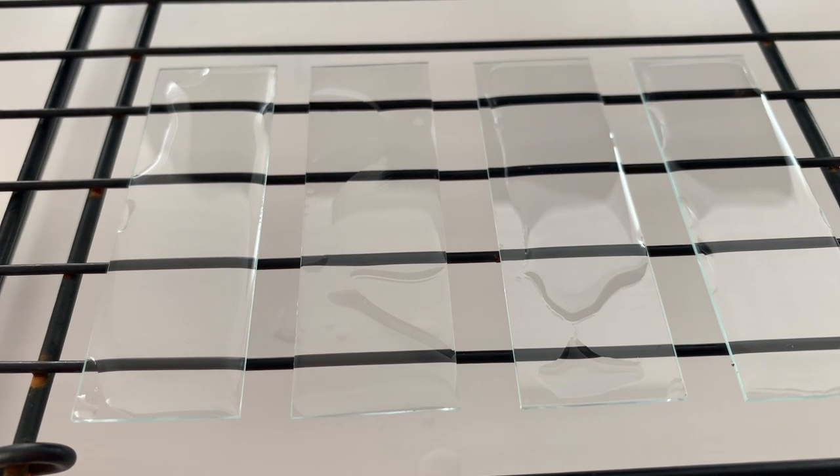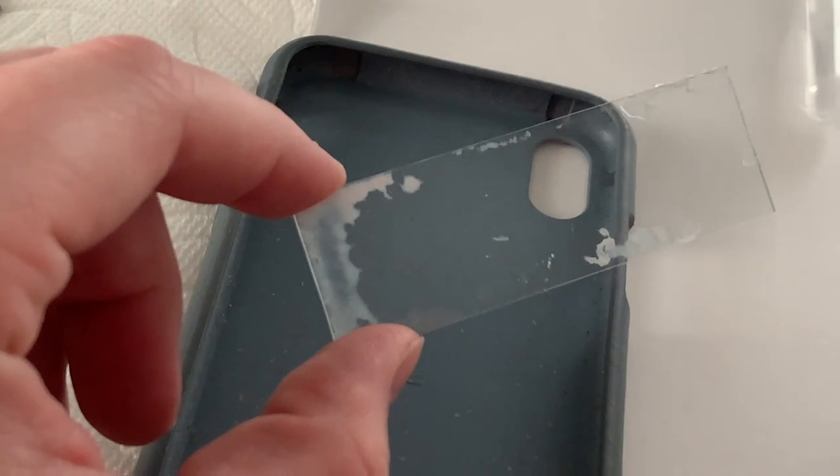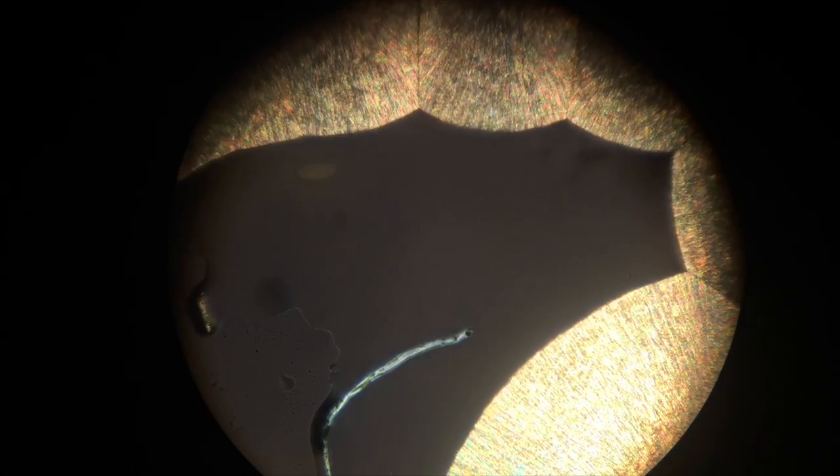After a little bit of time, you should start to see some crystals growing, and this is kind of what we saw after a few minutes. I decided to put this underneath the microscope while it was growing the crystals, and I added the polarized filters as well. So this is kind of what it looks like when it's growing — this is about 10 seconds of video, but it's a fast time-lapse covering about 30 minutes.